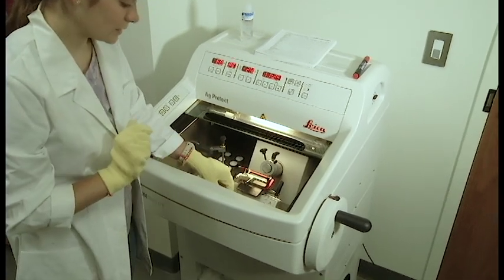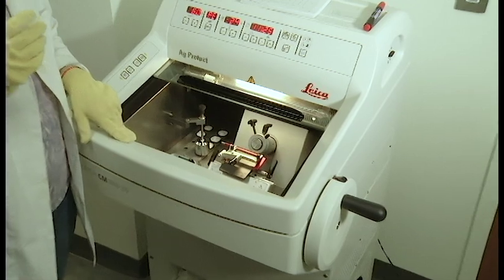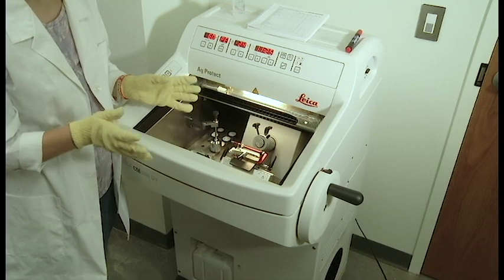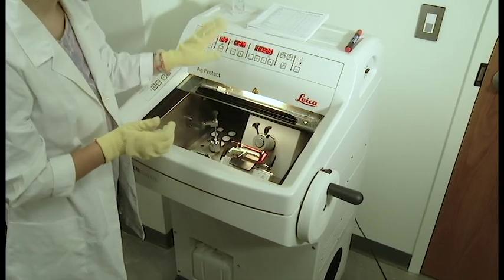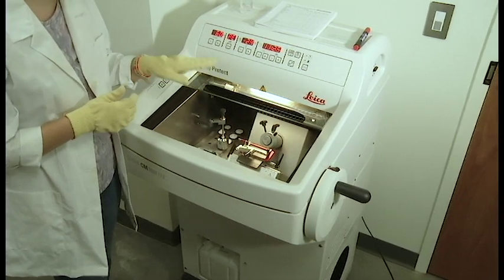Your tools should be kept inside of the cryostat area. If you were to take something room temperature and try and manipulate your slices, they're going to melt immediately. So be sure as your temperature is equilibrating to the colder temperature that they're placed inside.